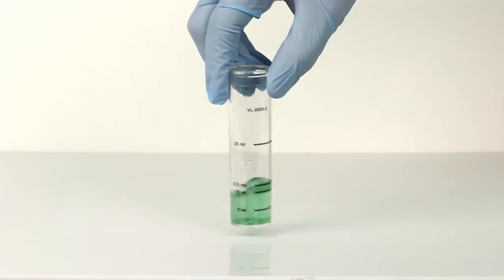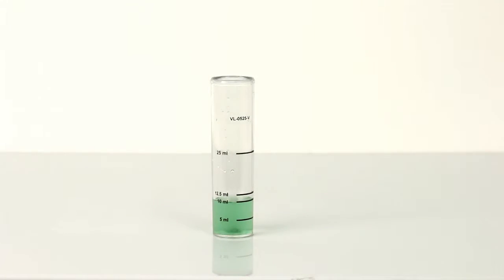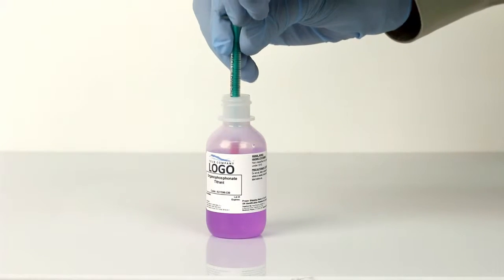For high alkaline samples, two or three tablets may be necessary to properly buffer the sample. The next step is to perform the titration.